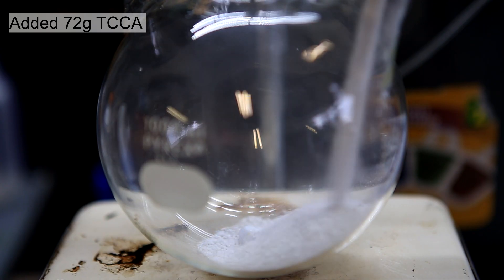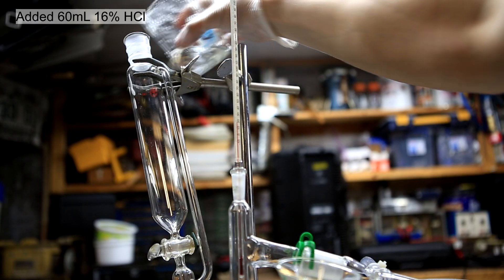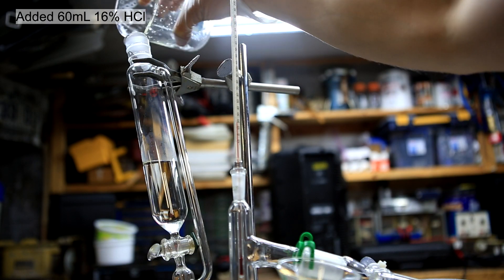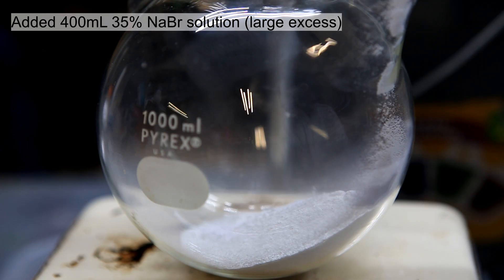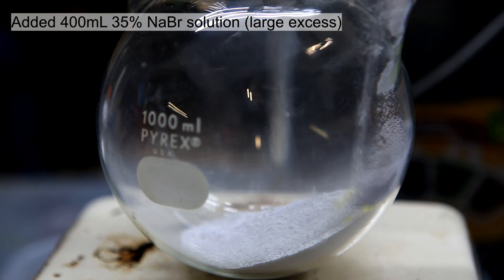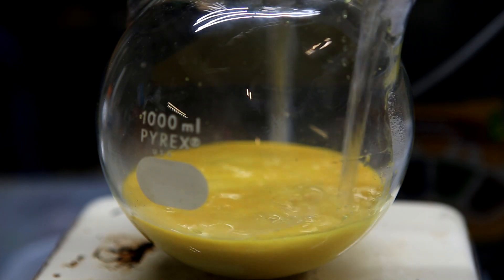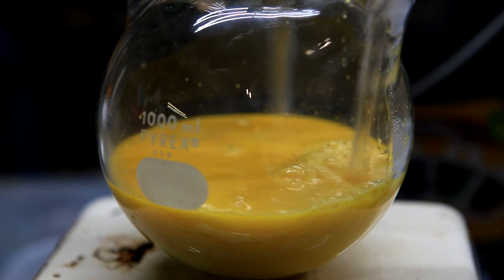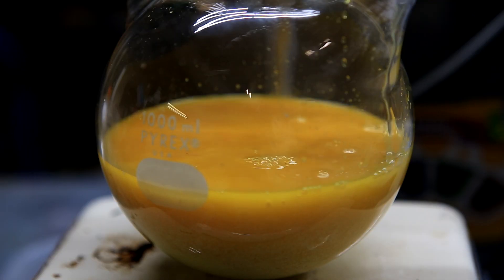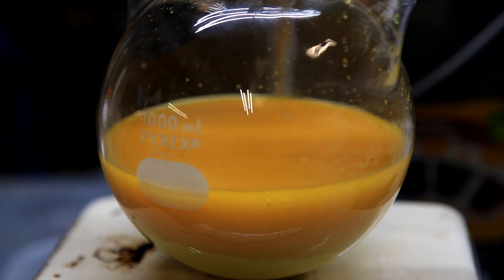To the round bottom flask is added 72 grams of crushed TCCA. To the addition funnel was added 60 milliliters of 16% hydrochloric acid. Then to the round bottom is added 400 milliliters of the 35% sodium bromide solution. Immediately upon addition, some chlorine comes off of the TCCA and liberates bromine from the sodium bromide salt. You can see here that a reaction occurs between the sodium bromide and the TCCA, which might explain why we actually don't need a stoichiometric amount of hydrochloric acid.